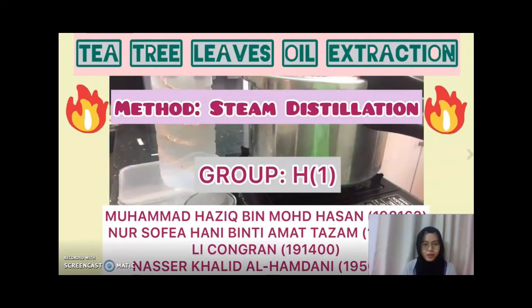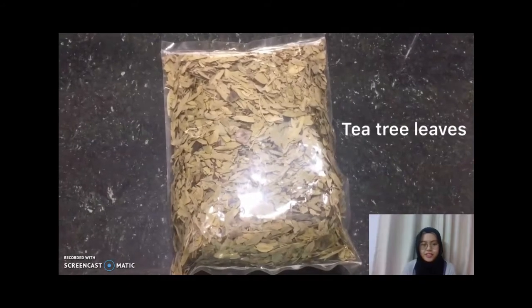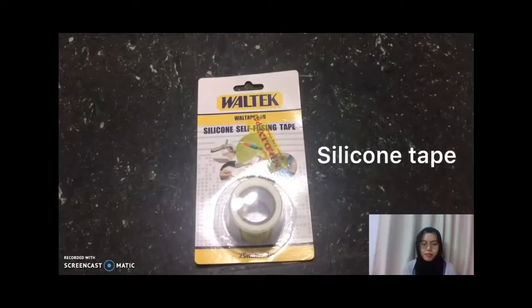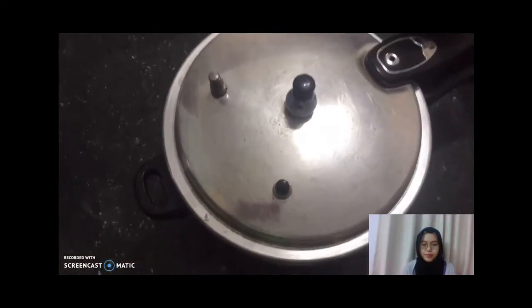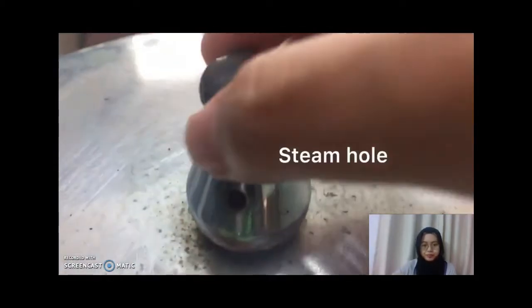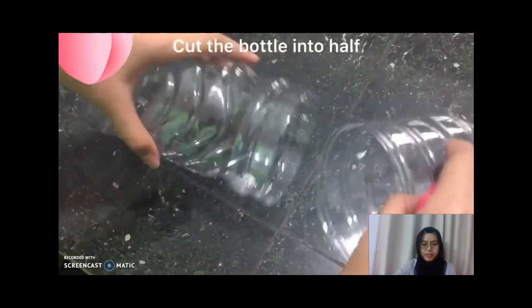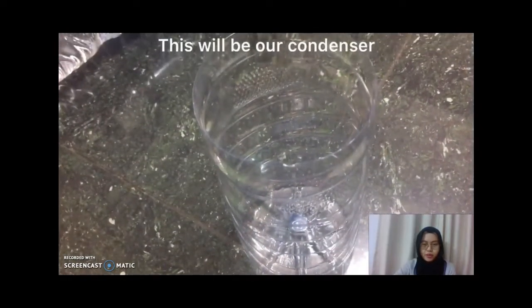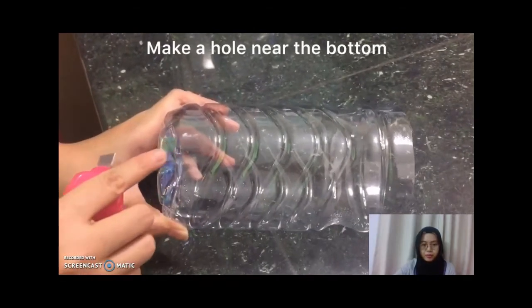We extract our oil from the tea tree leaf using the steam distillation method. So these are the materials and the equipment that were used in the experiment. We use the pressure cooker as our main equipment. So this is the DIY step by step. First, the bottle was cut in half, and this will be our condenser. Next, make a hole near the bottom of the bottle.